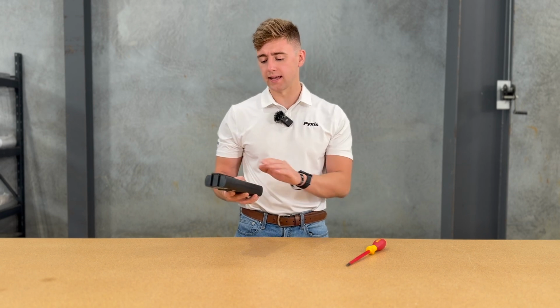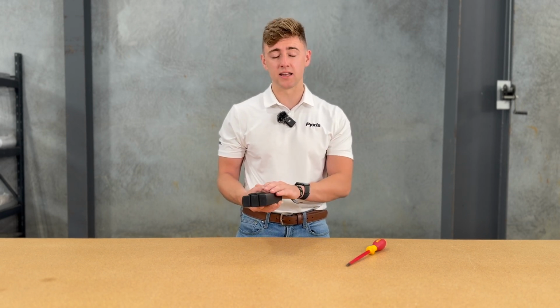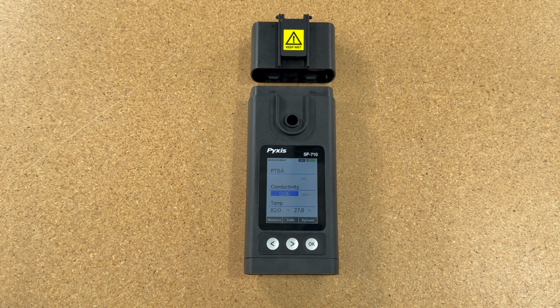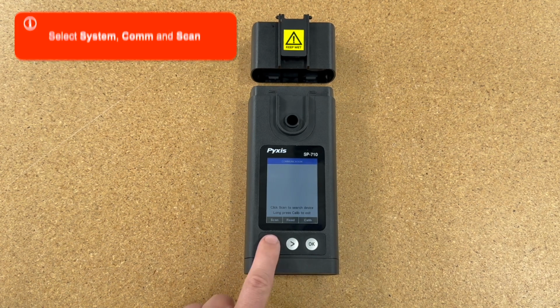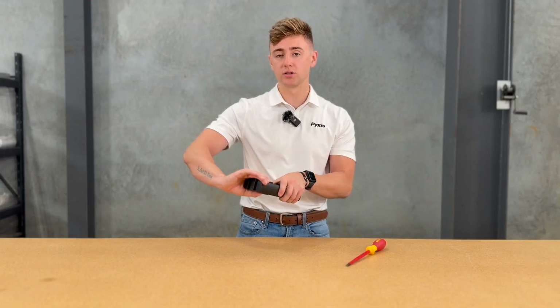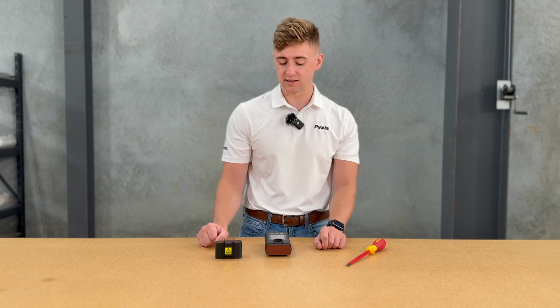So we'll go ahead and click the system button. On some devices it could say info, but on the 710 in particular it says system. Once we're in the device information menu, from there you can see the communication button in the center. Go ahead and press COM, and then you want to press scan to read for a nearby Bluetooth device. So let's say that this module is a new module or one that we just cannot connect to that's pre-existing.